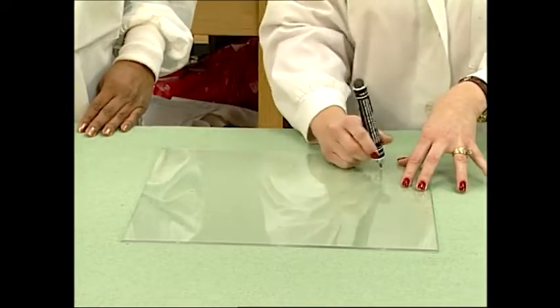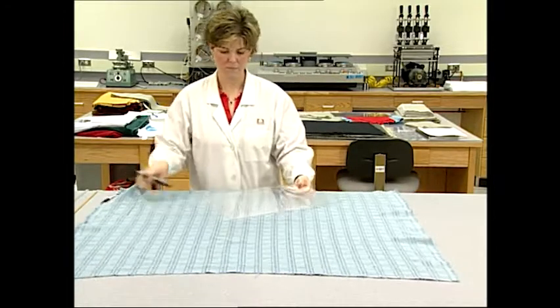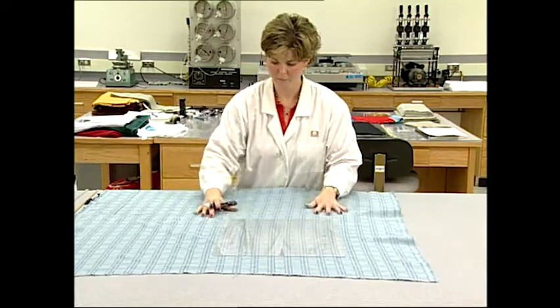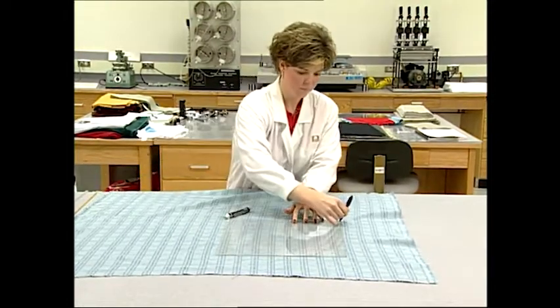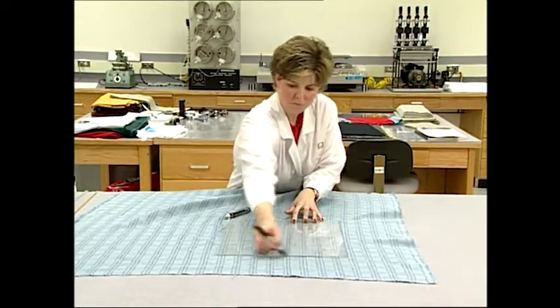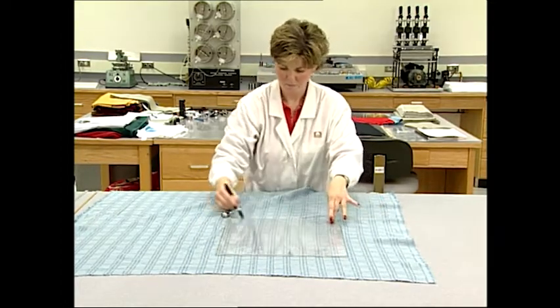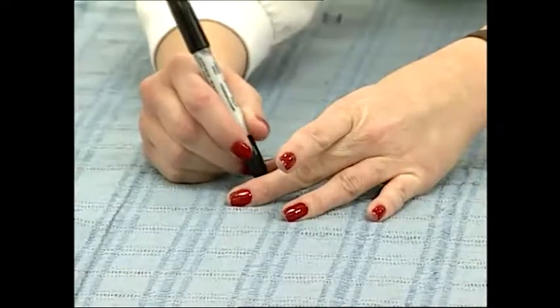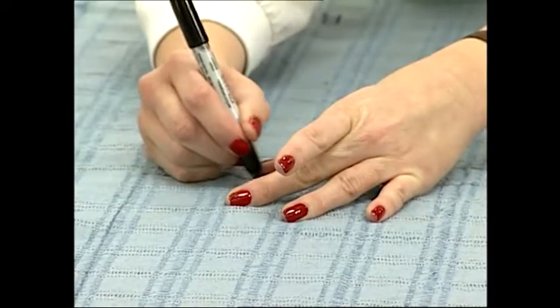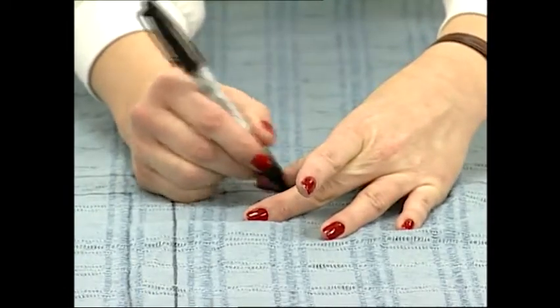Mark the outside edges of the template. A total of three specimens should be marked if enough fabric is available. The subsequent two specimens must be located so that different warp and filling yarns in wovens, or different courses and wales in knits, are included in the test. If enough fabric is available, the specimen should be laid out in a diagonal across the width and length of the fabric. If not enough fabric is available, then an L-shaped pattern should be used.